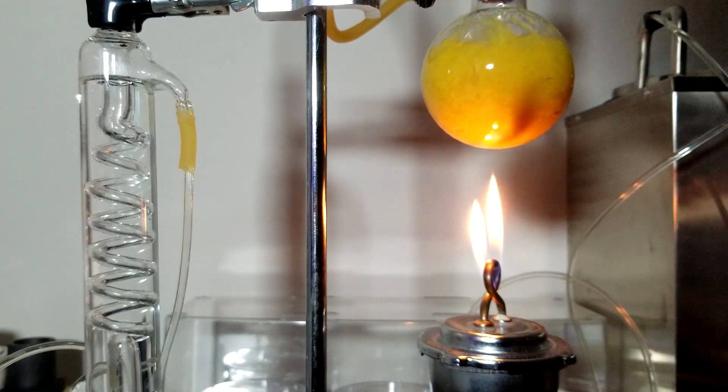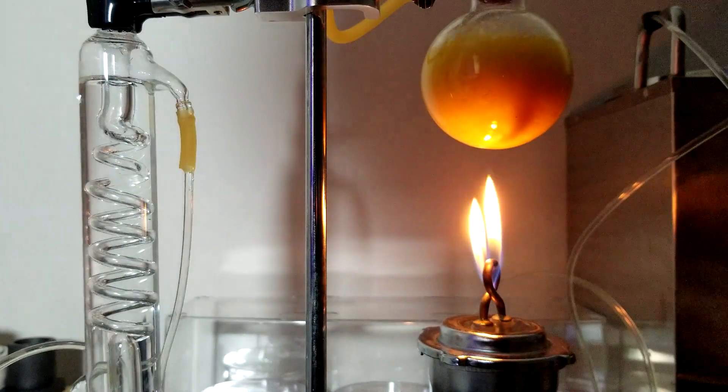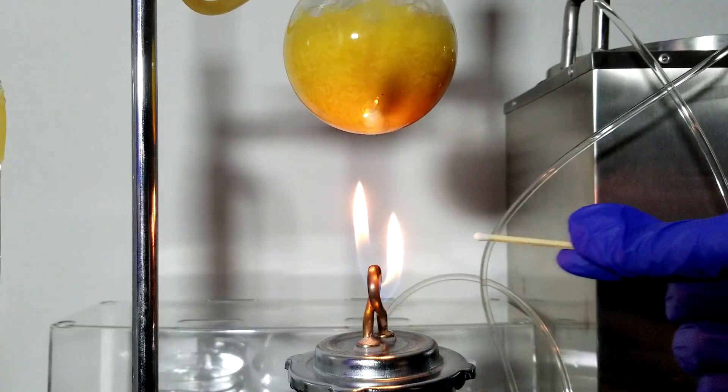To extract as much oil as possible, I had to leave the steam distillation going for about half an hour. This was obviously a boring process, so I played with a match for a while.